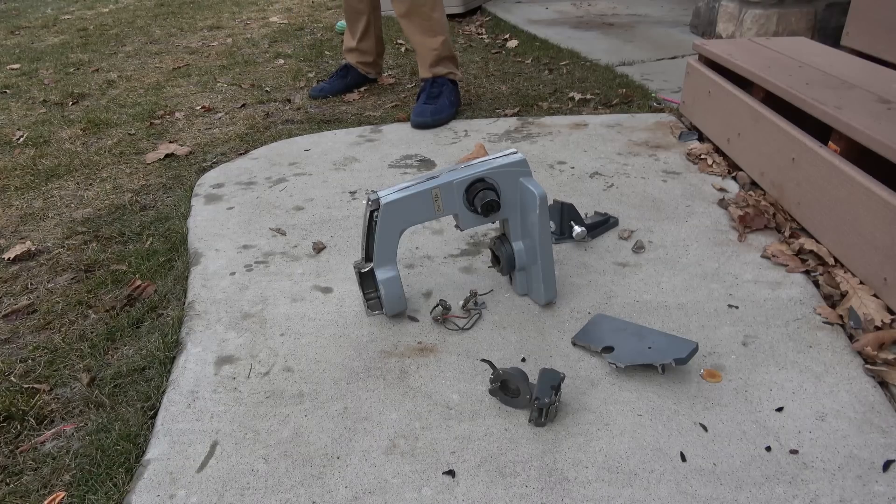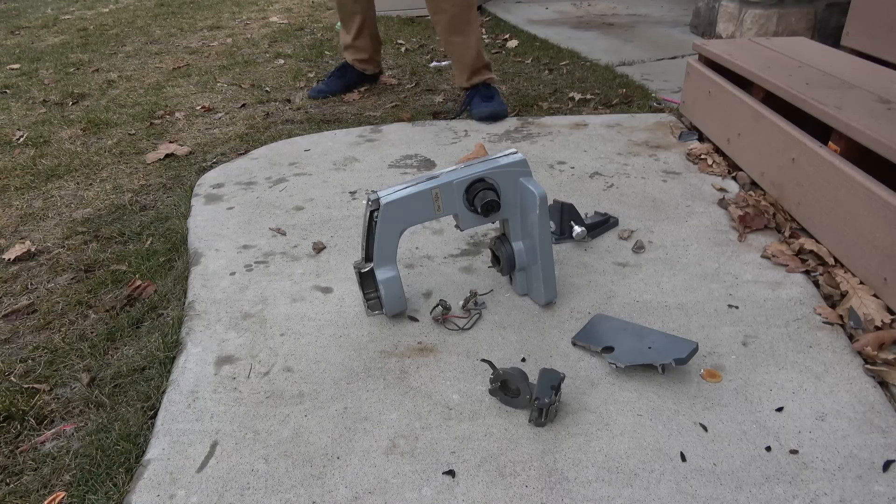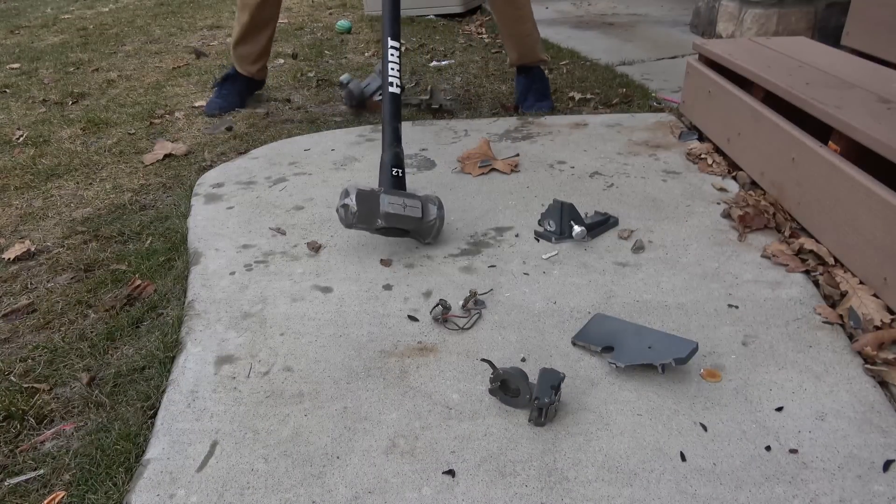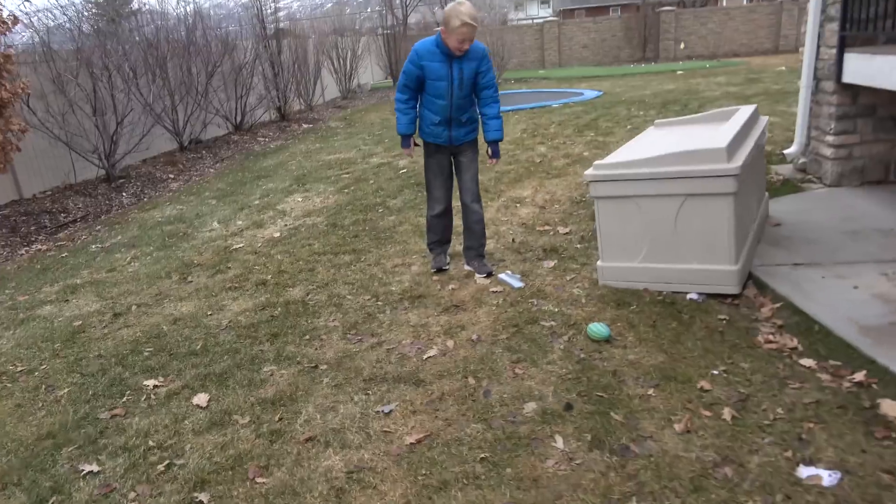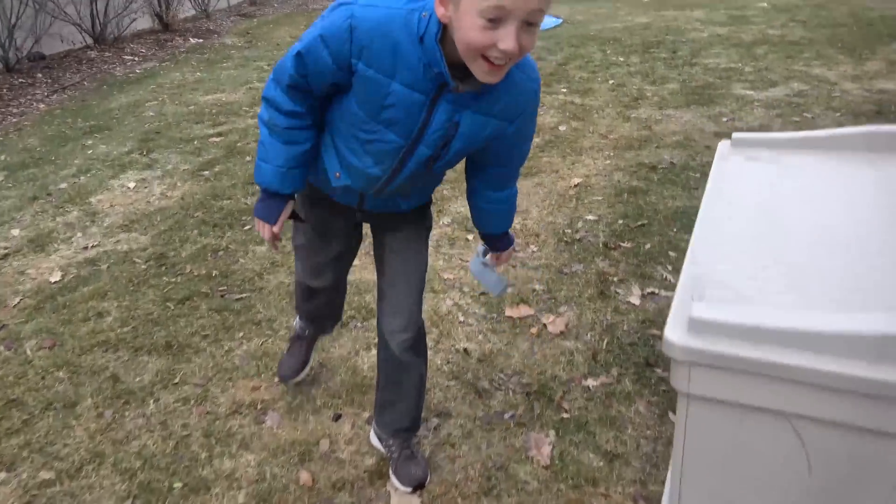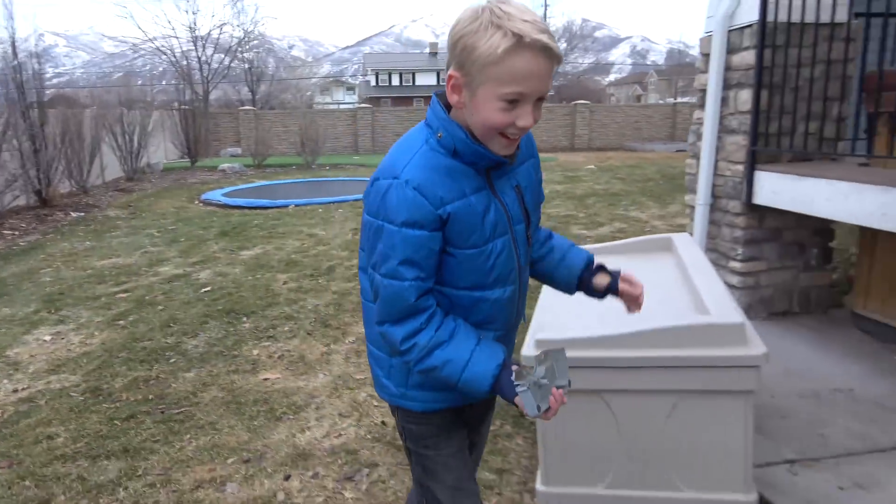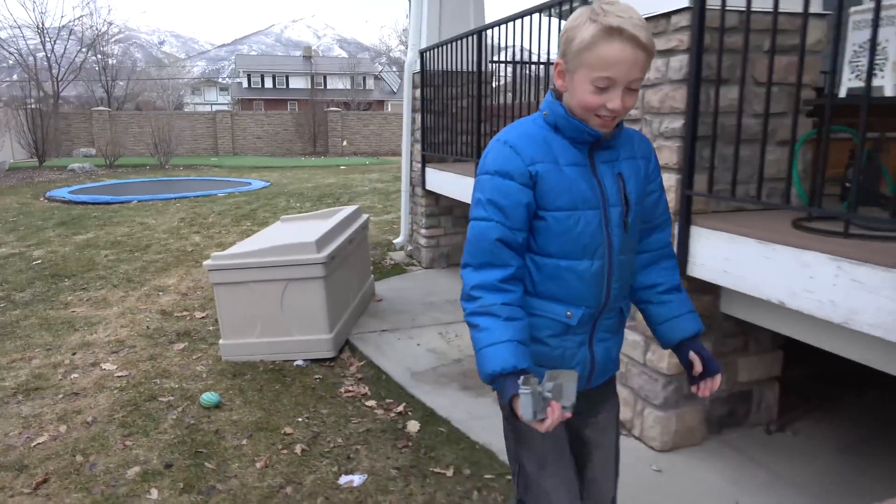All right. One, two, three. Whoa. It's shabby, it's shabby. Look at that. You just got to get it started with the saw and then you finish it off with the sledgehammer.